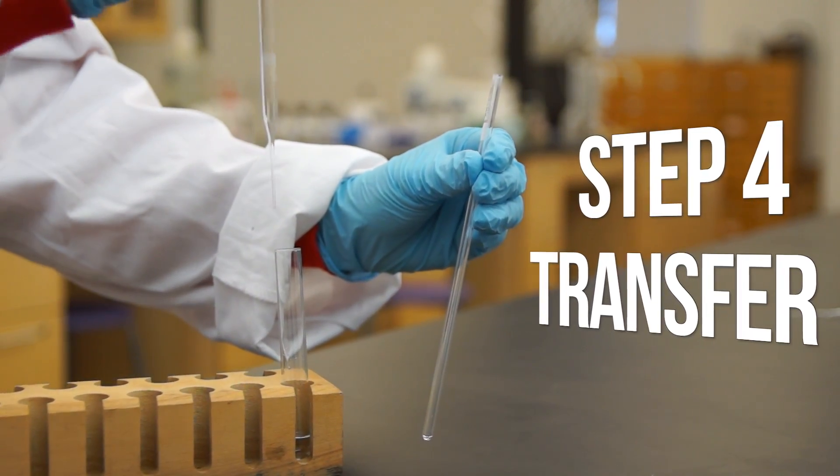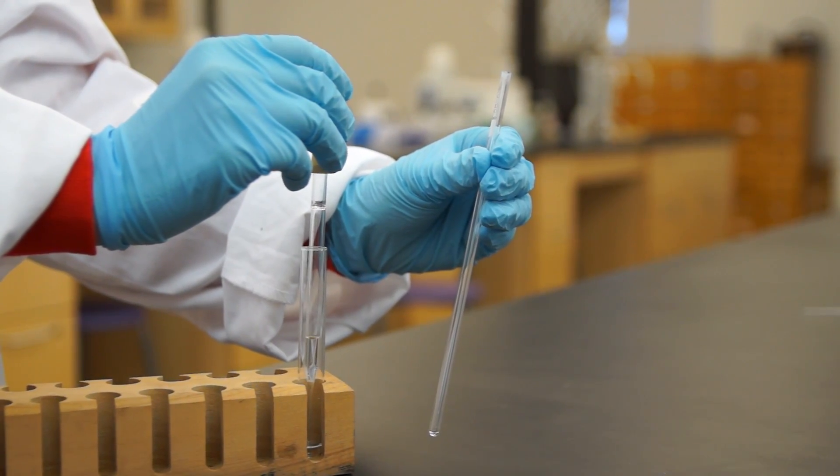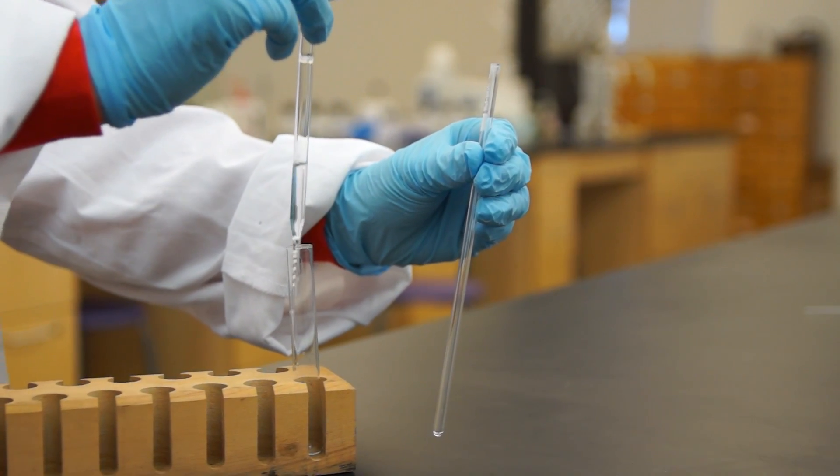Now, we're going to transfer our sample. Using a pipette, transfer your sample into the NMR tube.